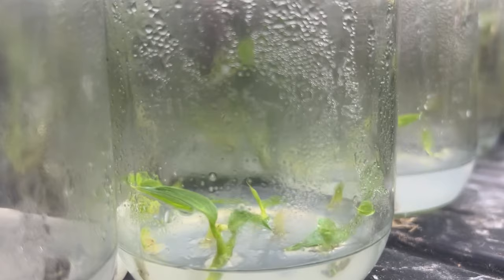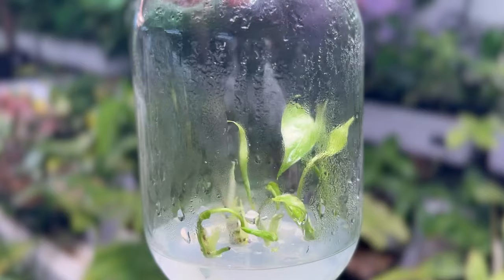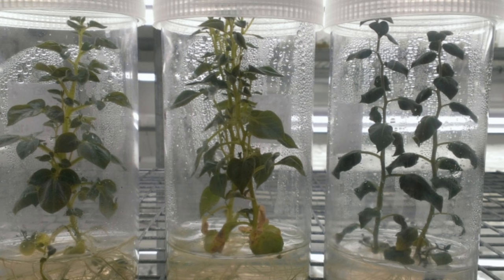The nutrient medium provides all the necessary elements for the growth and development of plant cells. The most common nutrient media is called MS and includes essential plant nutrients. We also add sugar, agar, and growth hormones such as BAP, which is a cytokinin and helps cells multiply. Over time, the plant tissue starts to grow and multiply, forming many different growth shoots that can further be subcultured.